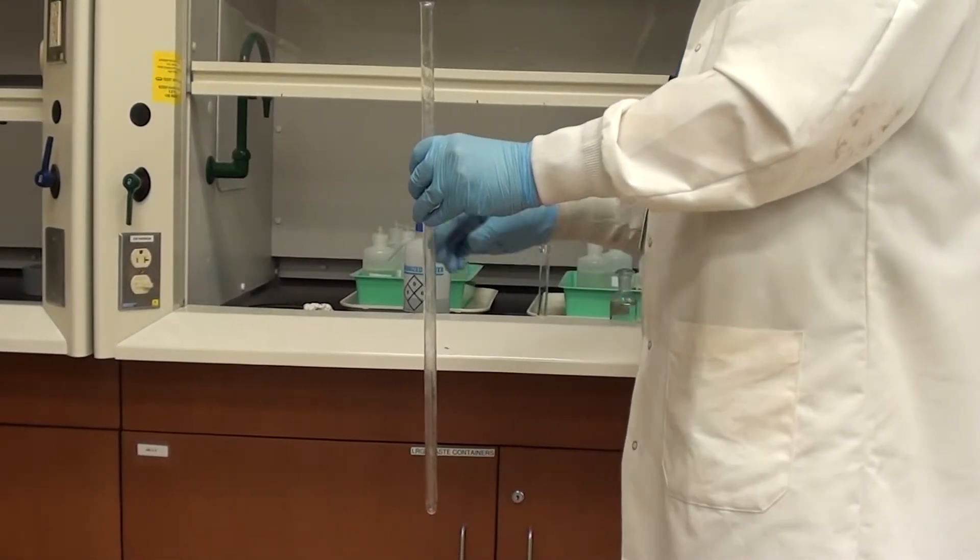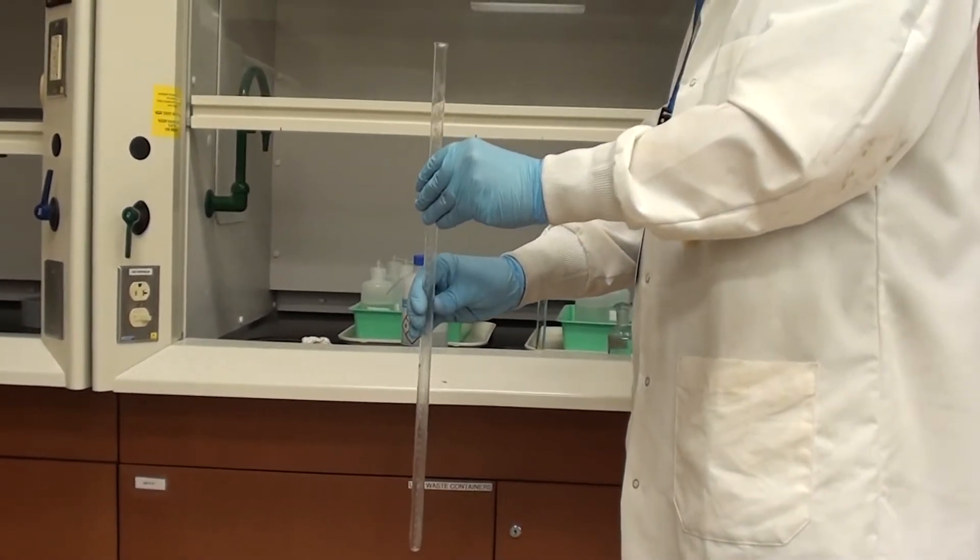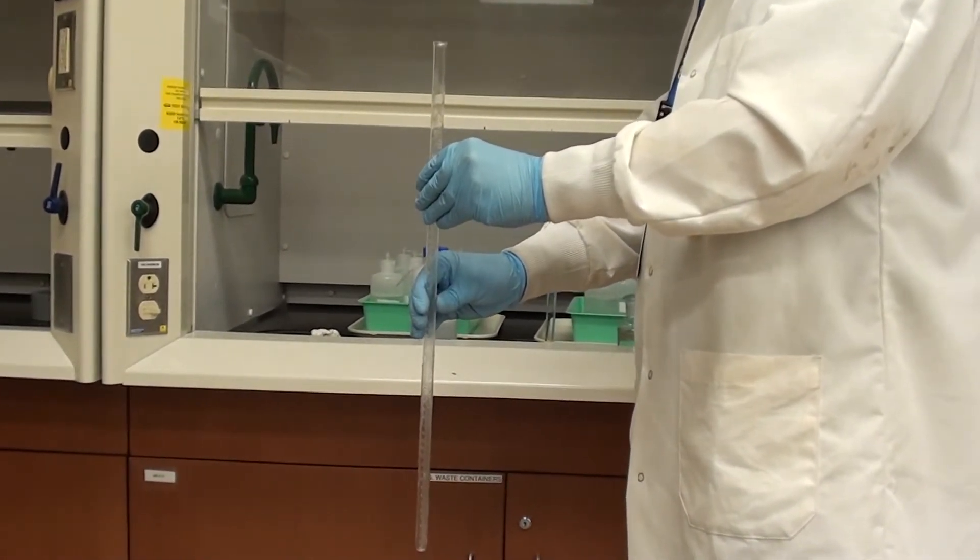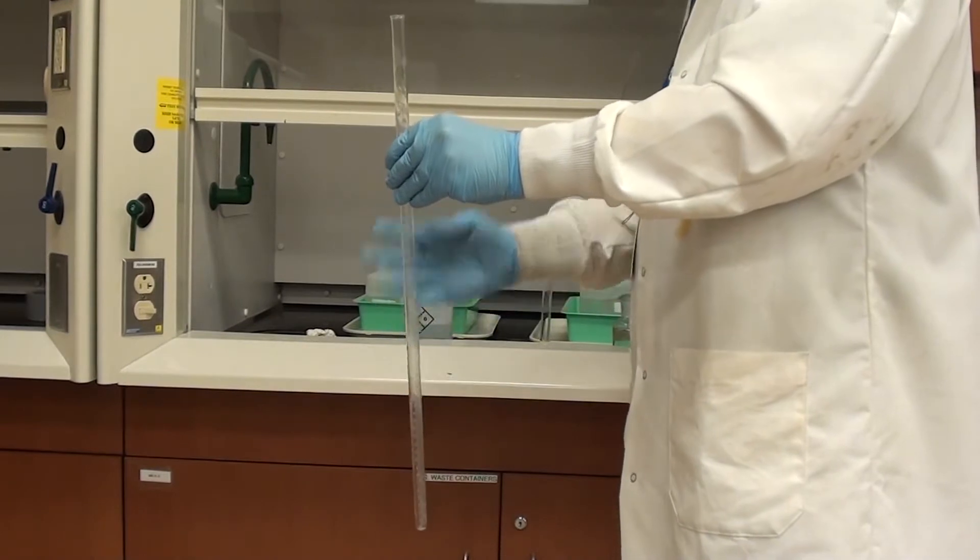Alright, so we've got our eudiometer tube. It's been calibrated. It doesn't have to be dry for this next step, but you do obviously need to have all the water poured out of it.